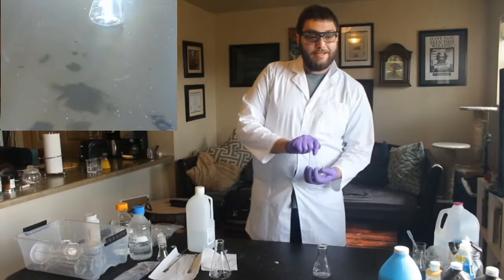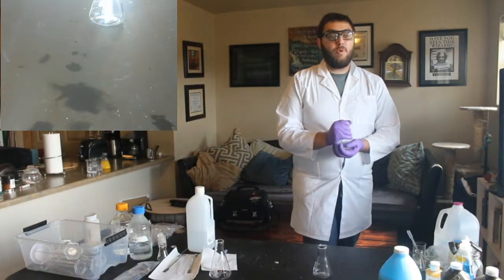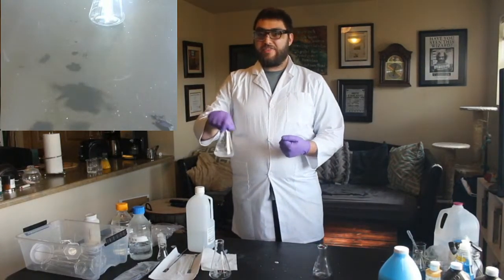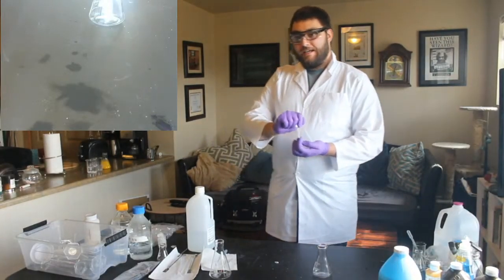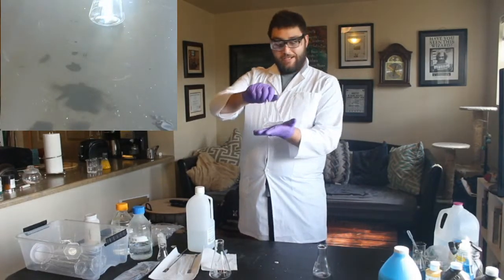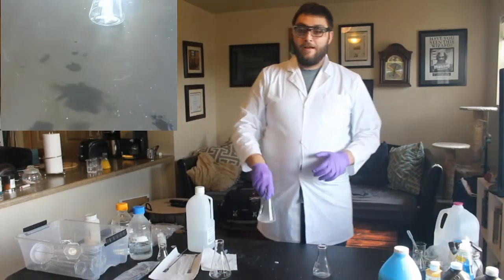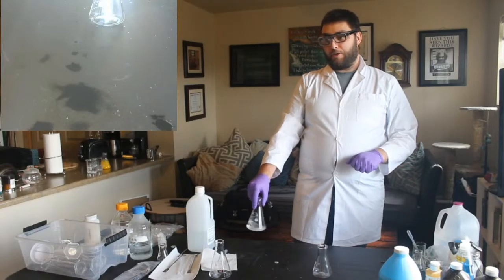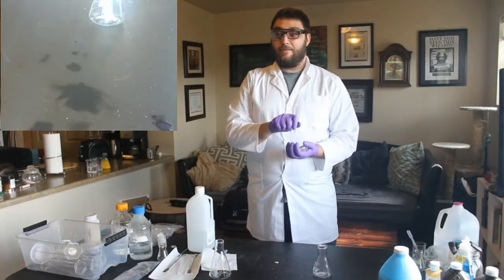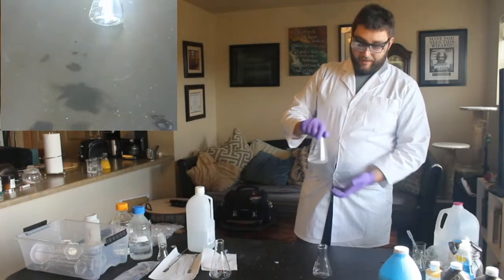You can't feel this, but this is cold. So because it's cold, it's what's called an endothermic reaction. Endo means in, and thermic means energy or heat. So this means that it's drawing heat into itself, which makes it feel cold. So it's taking my heat, or the heat in the air, and drawing it in. The opposite of that is an exothermic reaction, which means heat out. Exo means out, and thermic, again, is the same thing as energy or heat. So that means it's putting off its own heat, and it's going to feel hot.